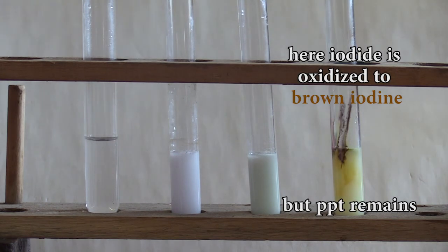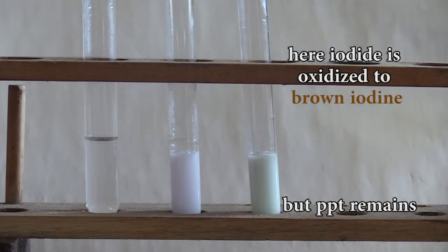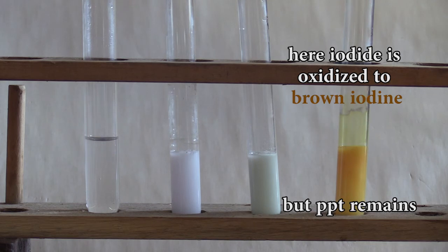And in the final test tube, the iodide is oxidized to iodine whilst the precipitate remains.